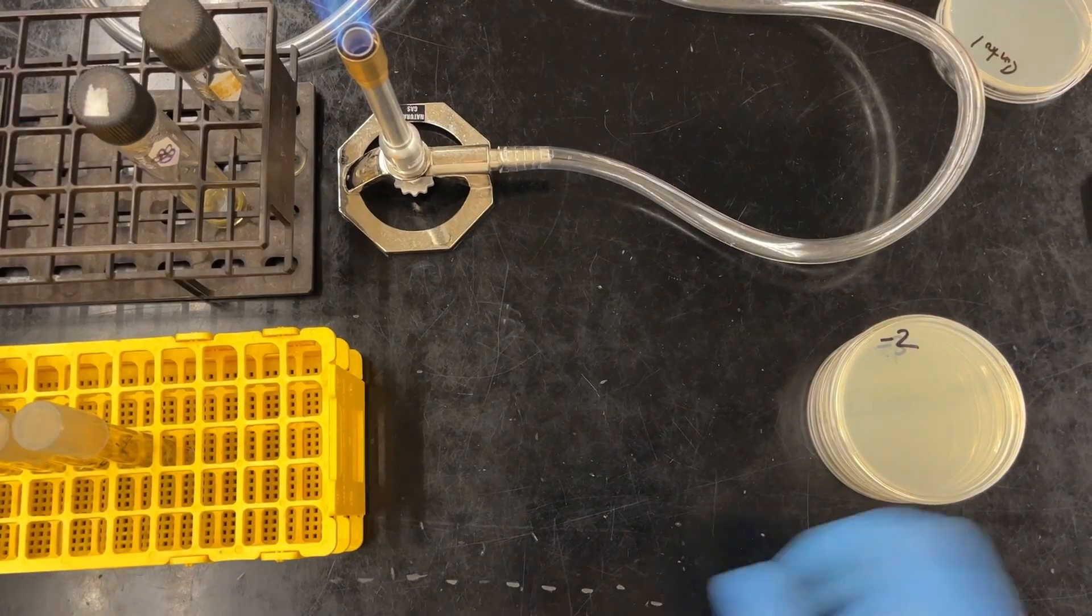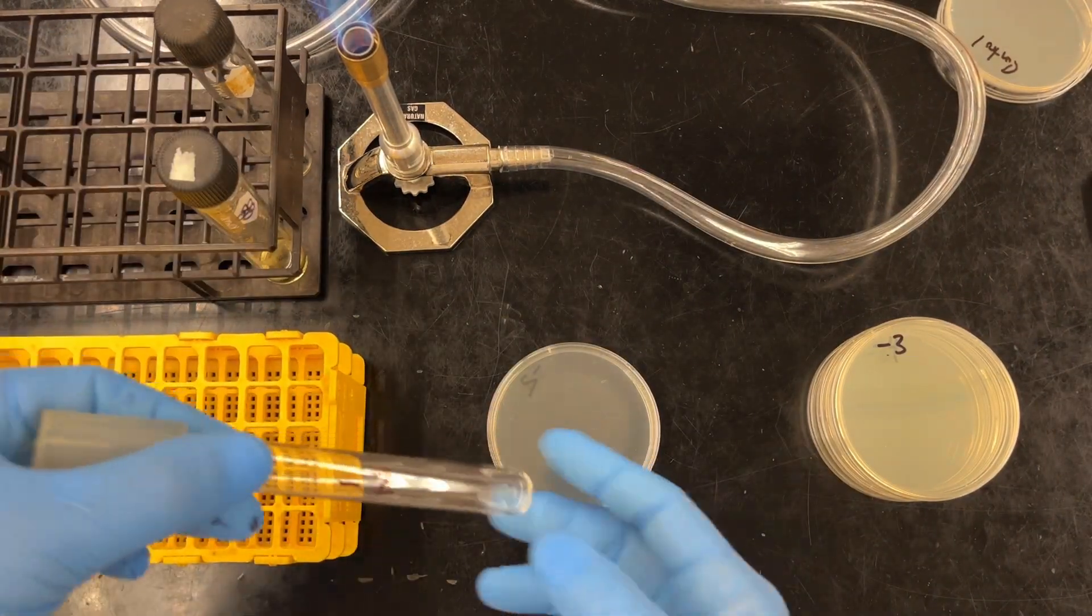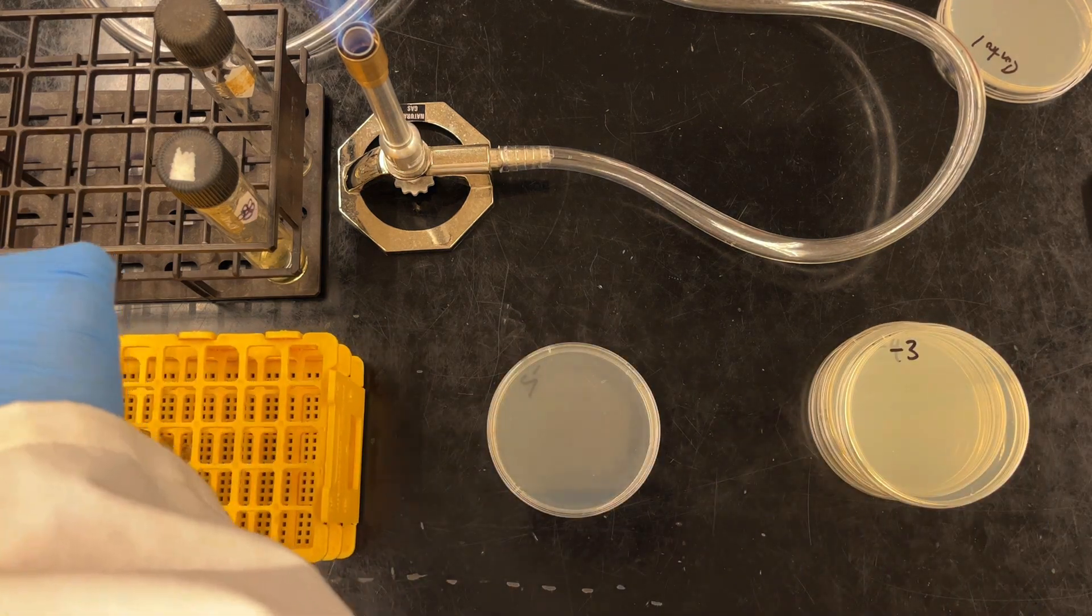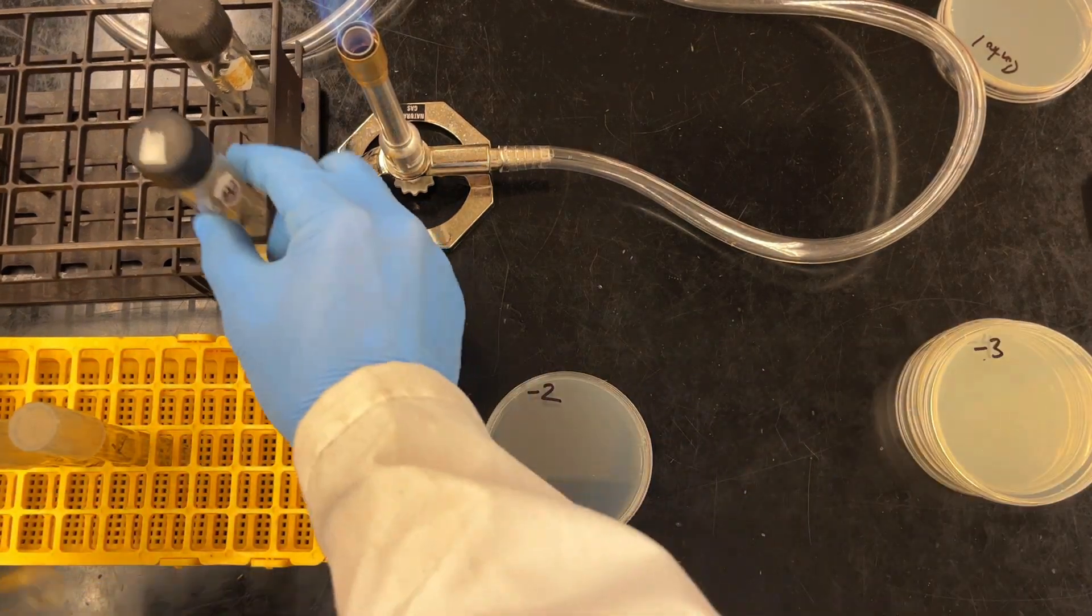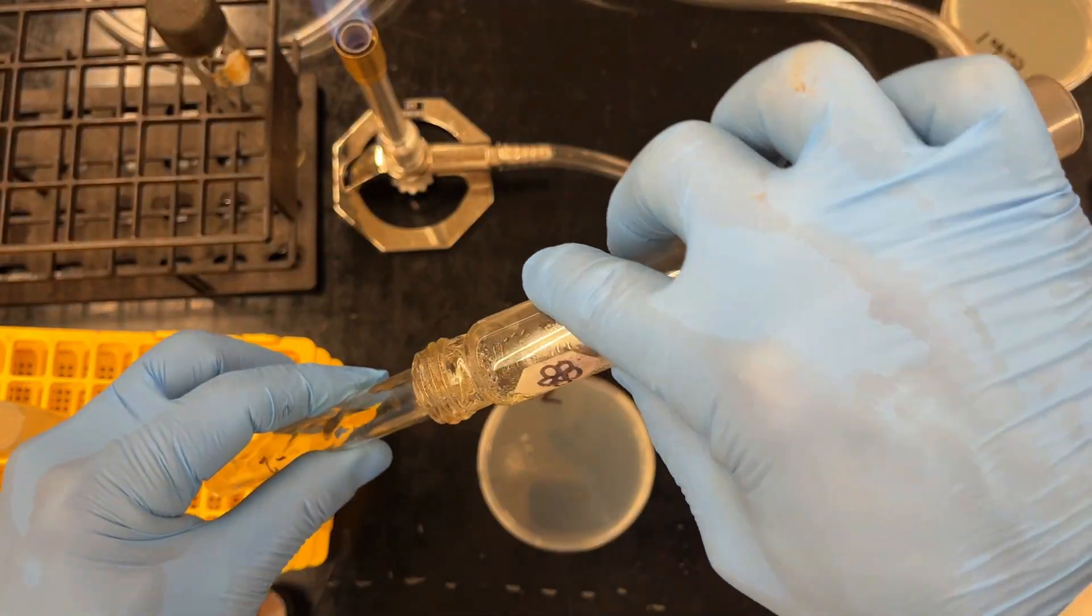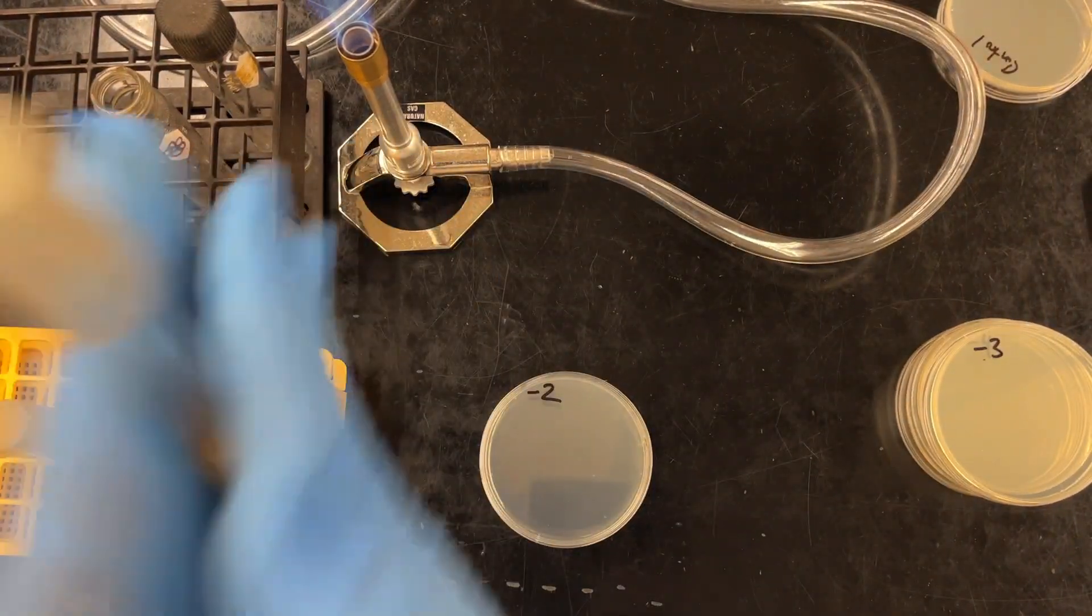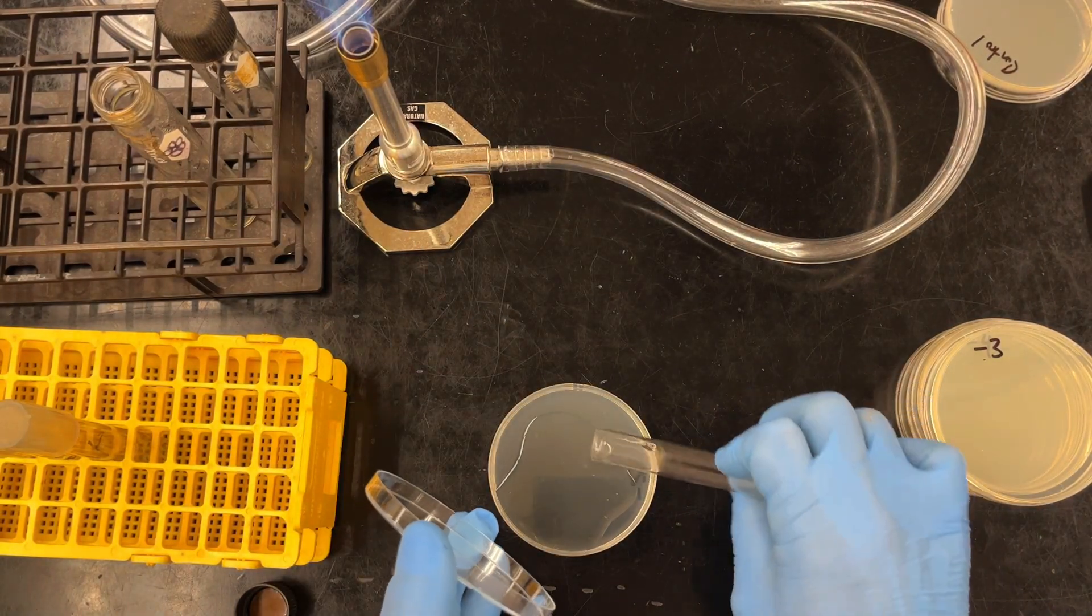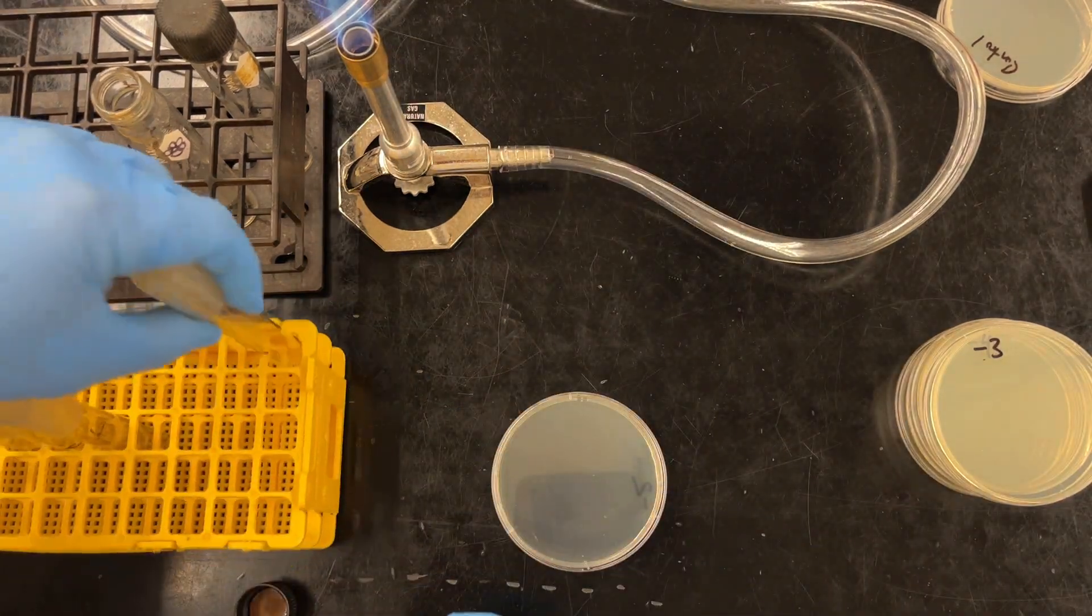Okay, this is where things start getting a little crazy. We are going to use molten agar. That's agar that's been warmed. But there's like this time limit that we have. So it stays molten for about a minute to two minutes. But as soon as it hits the plate, it starts to solidify very quickly. So just make sure that you're organized. I already took molten agar out. I probably shouldn't have done that. Usually I like to take my agar out right before I use it. Pour the molten agar into your phage bacteria buffer mixture, give it a really good mix, and then lay it over top your agar plate. So right in the middle. And then very quickly, kind of like you're coating a pan with oil, make sure that it's coated evenly. And then that's done. Out of the way.